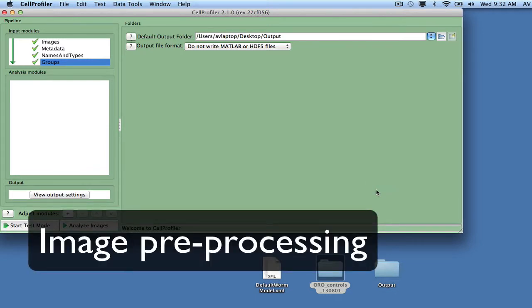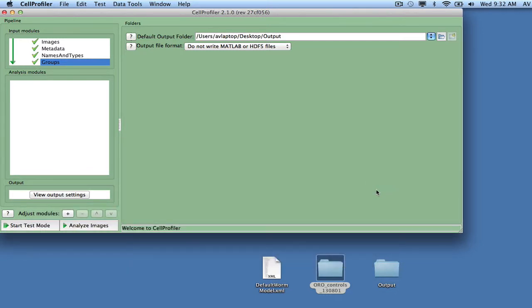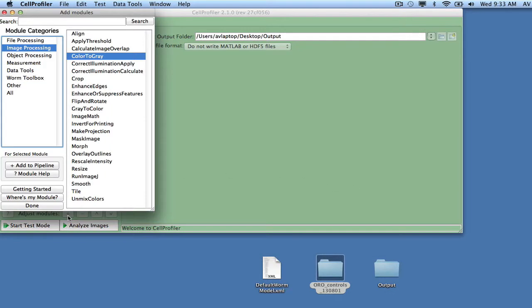Once the input modules are set, the analysis pipeline is built up by inserting modules into the analysis panel. Modules are added by clicking the plus sign next to Adjust Modules in the bottom left corner of the interface to bring up a list of selectable modules. Most object detection methods in CellProfiler are designed for bright objects on a dark background. Since the input images are color images with a bright background, the first thing we need to do is to invert the image pixel intensities, adding the module called ImageMath located under the module category ImageProcessing.